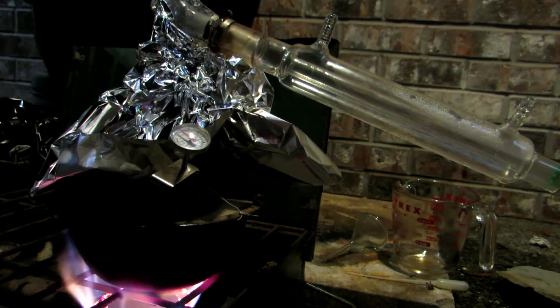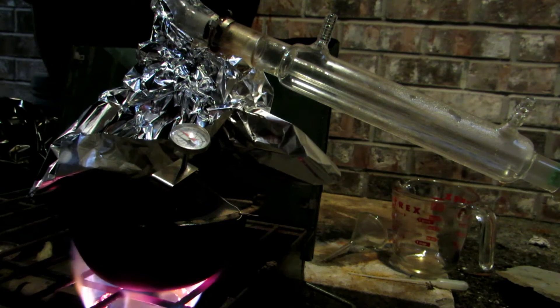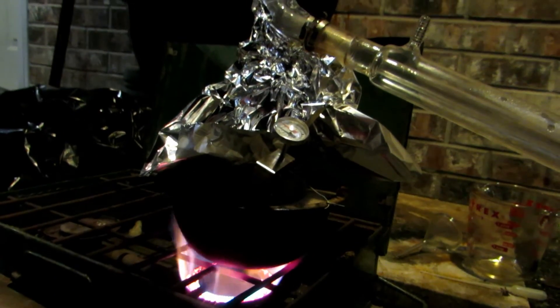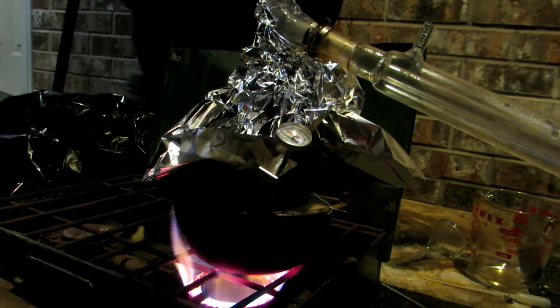Of course, the flask itself is not that hot yet because we're not distilling sulfuric acid yet — we're still driving off water. We'll continue to let this all distill. As you can see out here, we're actually getting a nice little blanket of snow forming. I'll meet you back as soon as we start collecting our sulfuric acid.